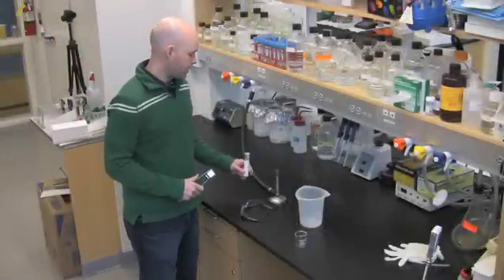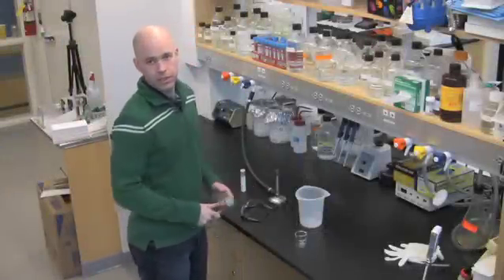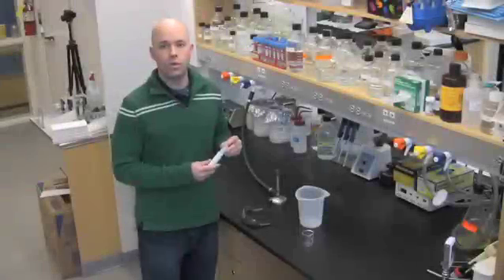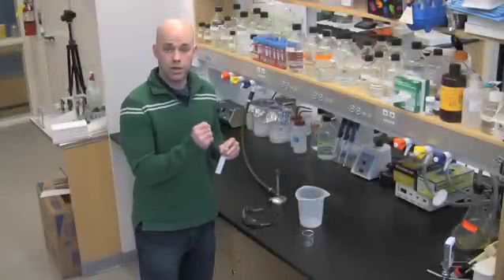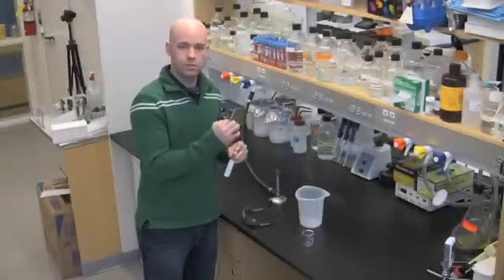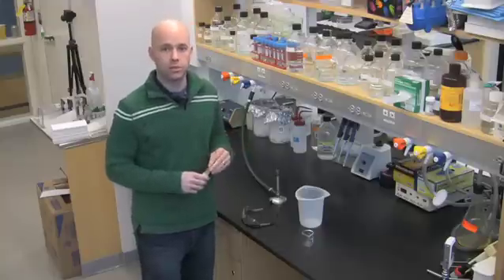What we'll need are some capillary tubes, a Bunsen burner, and a couple of beakers. We're going to be pulling capillary tubes in order to minimize the diameter on the spotter, thereby allowing us to have the smallest spot possible on the TLC plate.